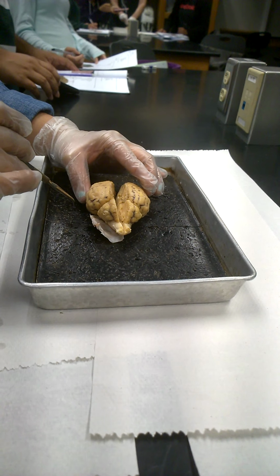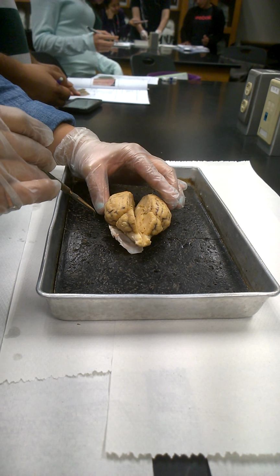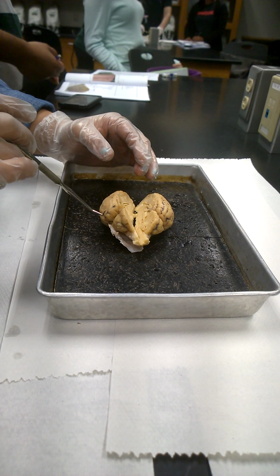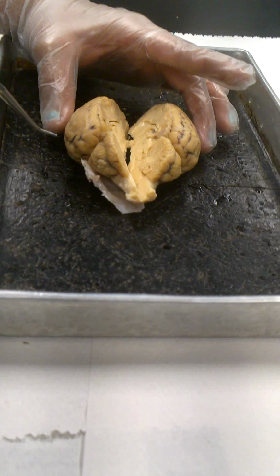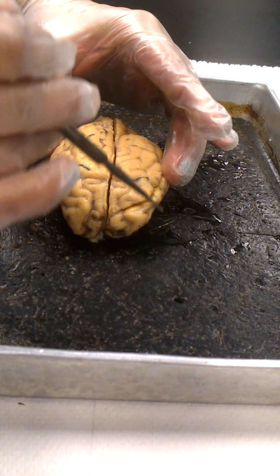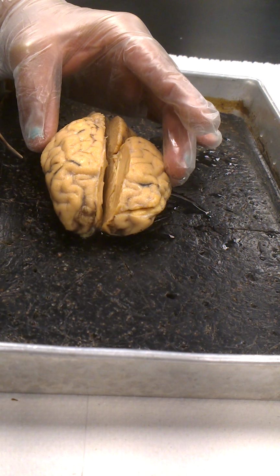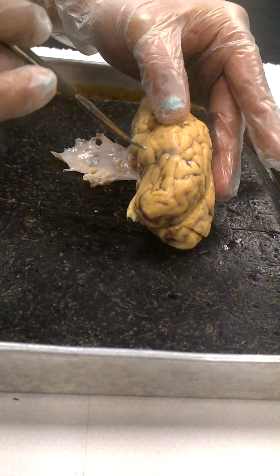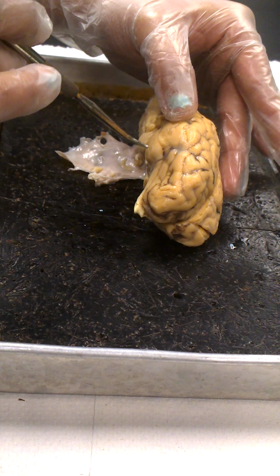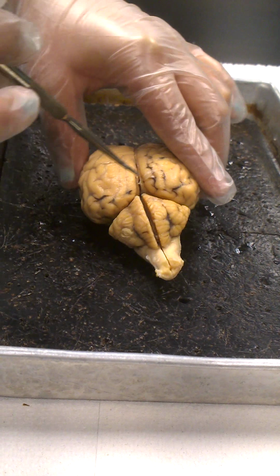The cerebrum is divided up into lobes the same way that you divide up the bones of the skull, and they're named in the same fashion. So we have a frontal lobe here on each side, parietal lobe, sides of the cerebrum, the temporal lobe, kind of stuck a little bit down underneath here, and the occipital lobe, which is the back portion of the cerebrum back here beneath the occipital bone.